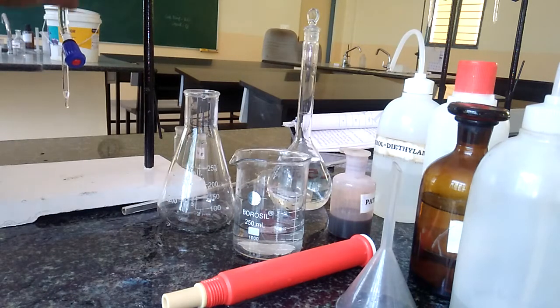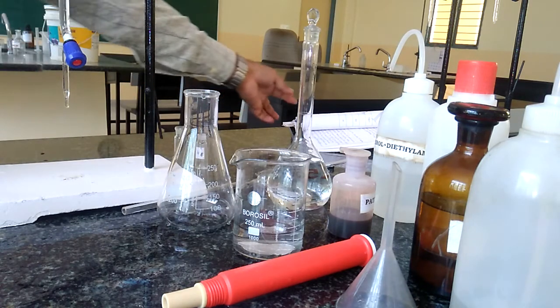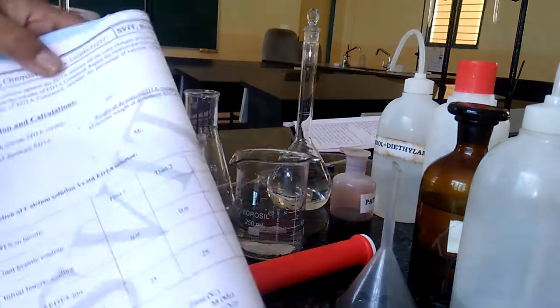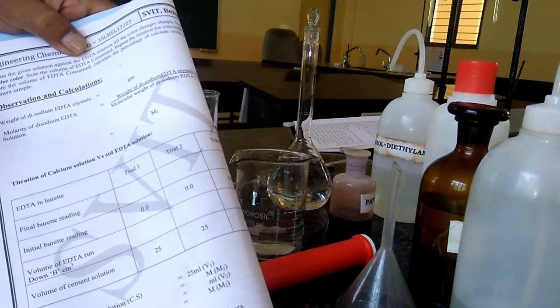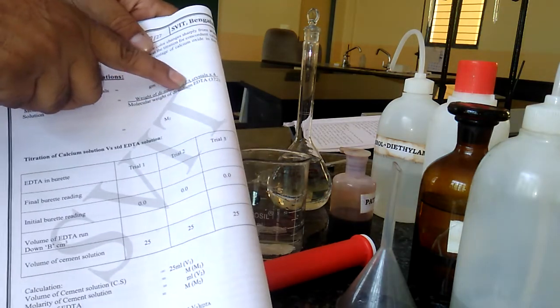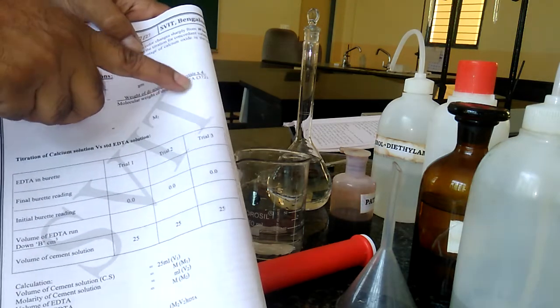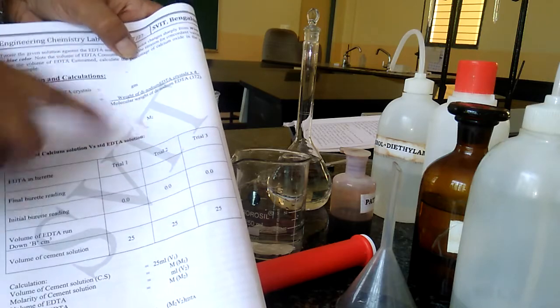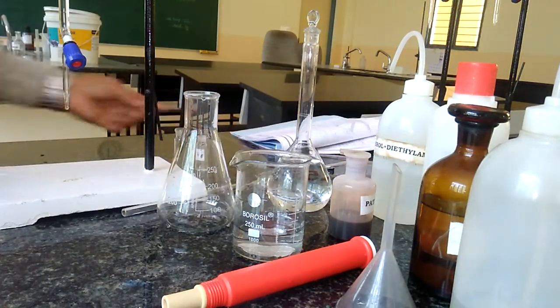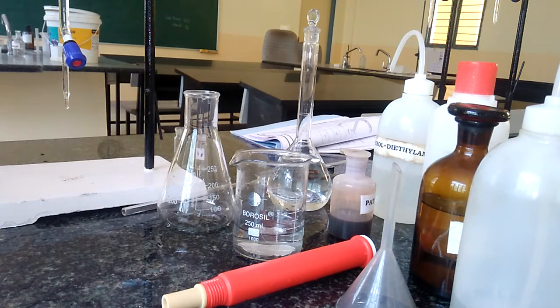As soon as you complete this, we have to fix it into the burette stand and then immediately calculate the molarity. Molarity can be calculated using this formula: Molarity of EDTA equals weight of disodium salt taken divided by molecular weight of disodium salt — that is 372 — multiplied by 4. This gives the molarity of EDTA. After this, let us go to the second part of the experiment, which is the titration part.